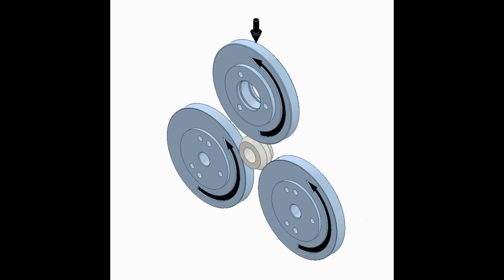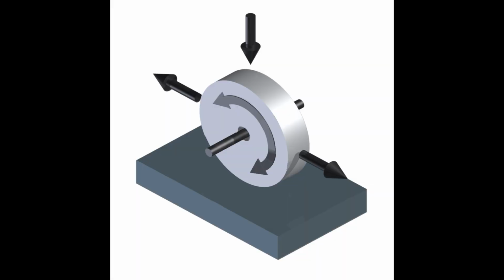Conventional micropitting rigs typically have a rod sample loaded between 3 supporting rollers, which are driven at different speeds to generate constant slip. Such rigs are usually expensive and require 1 test roller and 3 driving rollers per test. By comparison, micropitting tooling on a reciprocating rig can use simple, inexpensive samples and provide continuously varying slide roll ratios, as happens in actual gear contacts.